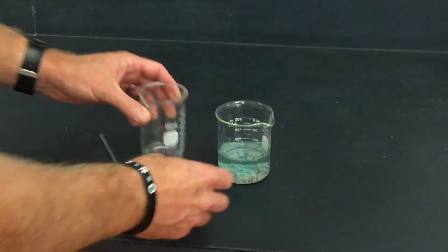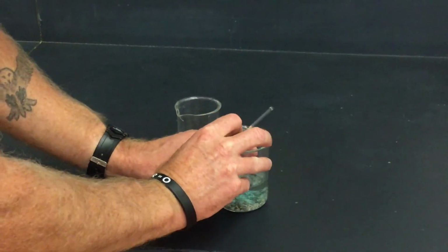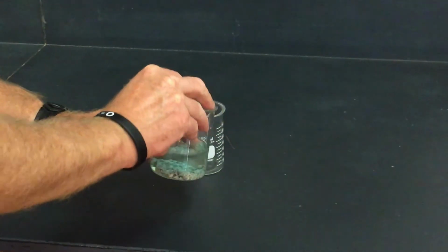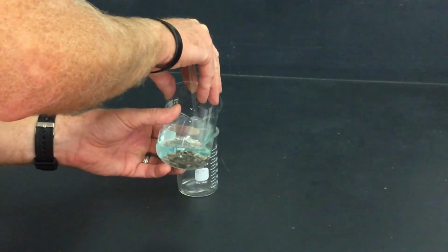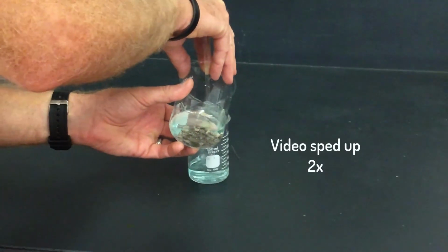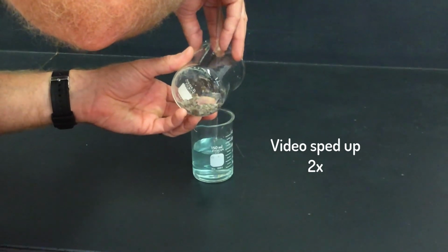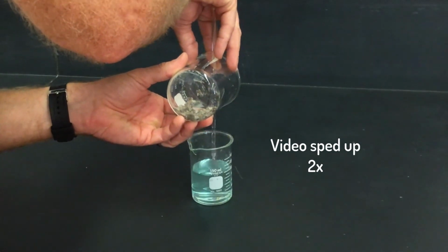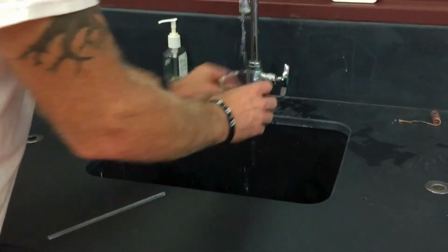Get a 150 milliliter beaker, label it in the white spot with your initials and your period number, then carefully decant the blue liquid from the 250 milliliter beaker into the 150 milliliter beaker. Make sure the solid stays in the 250 milliliter beaker.